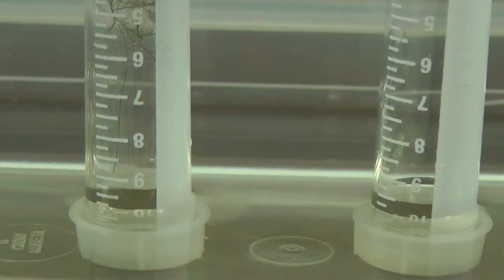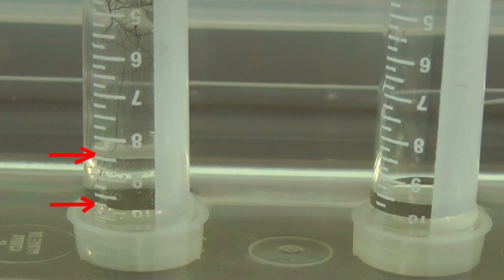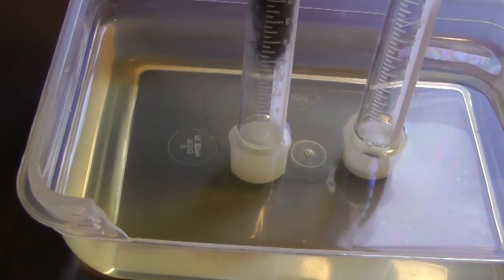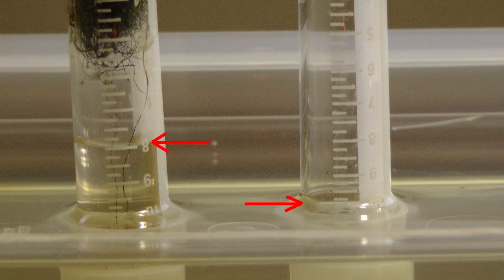The process is very slow. This time lapse covers 1 hour. In this period, the water moved up 1.5 milliliters on the scale. As the oxygen depletes, the process slows even more. I set the equipment up again, and this time let it run overnight, about 8 hours. The next morning, the water level had settled at the 8 milliliter mark. The water level in the control is unchanged, confirming results.